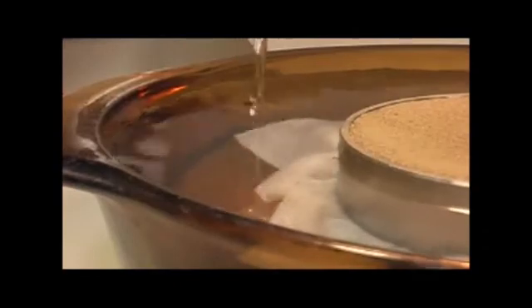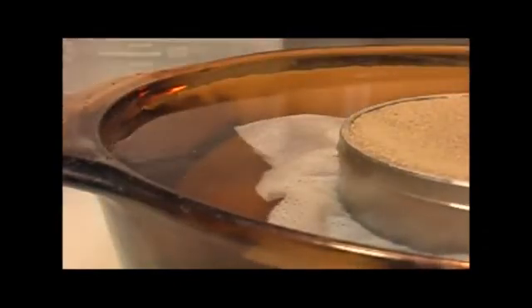Place it in a bucket and fill with water to just below the top of the ring, allowing the sample to saturate from the bottom up. Leave it overnight.